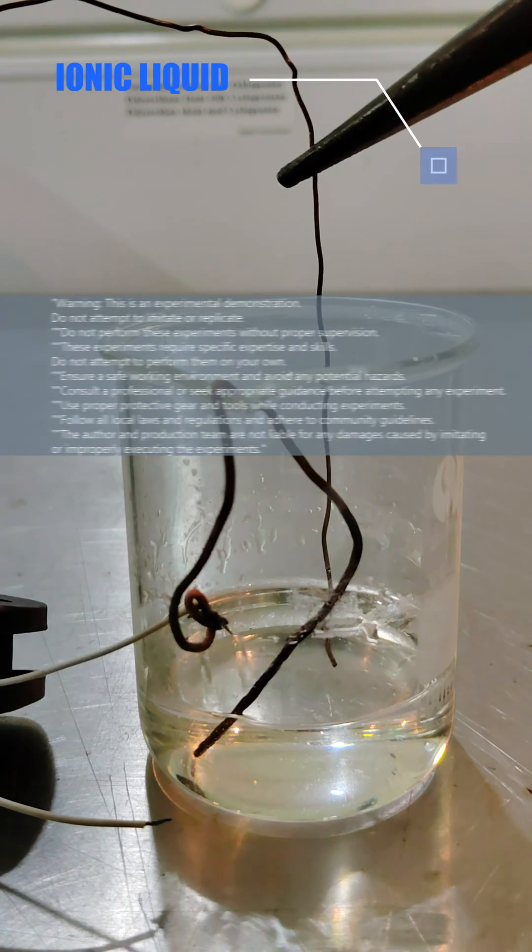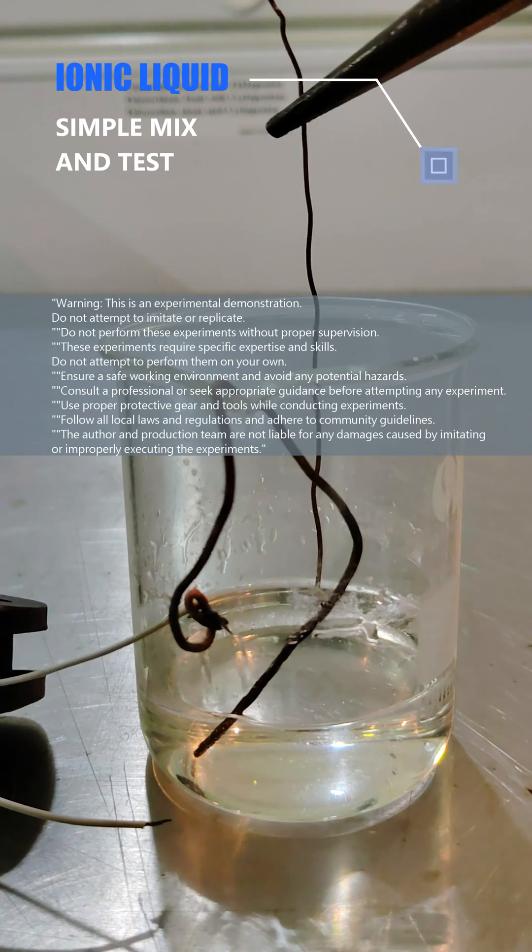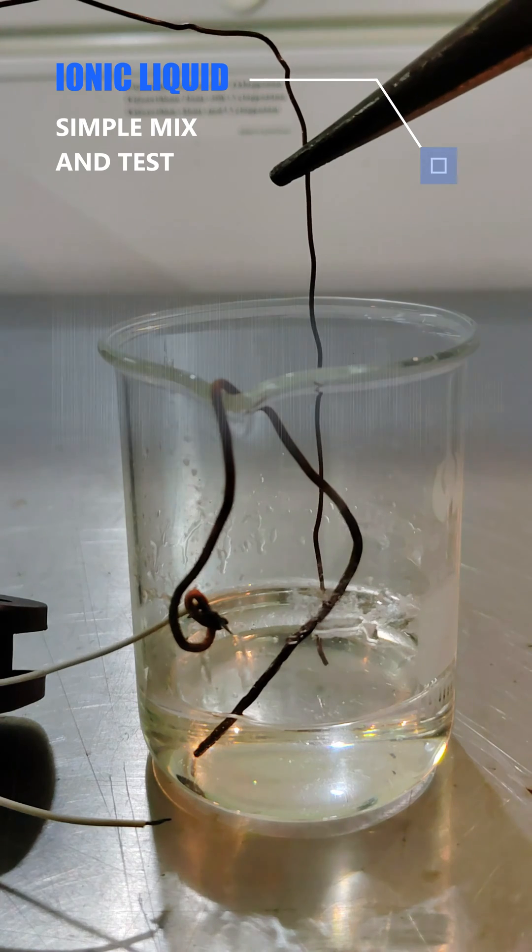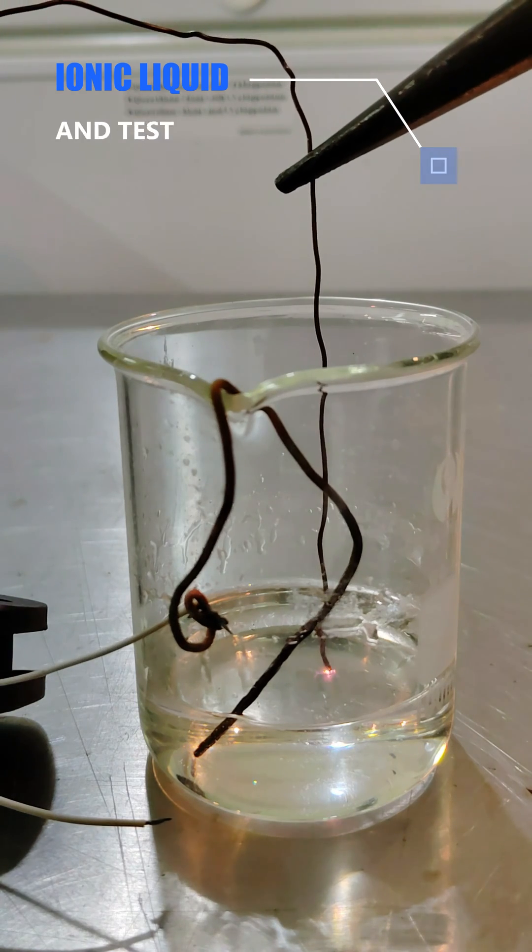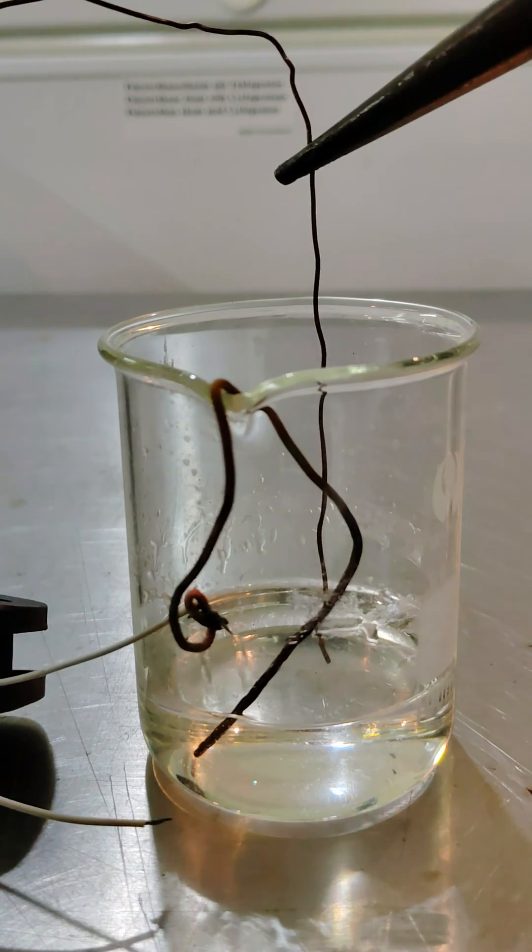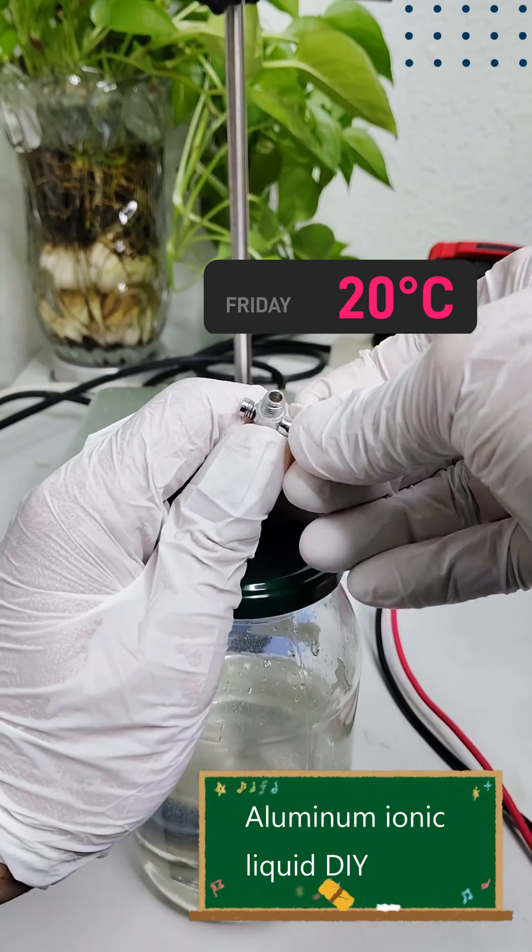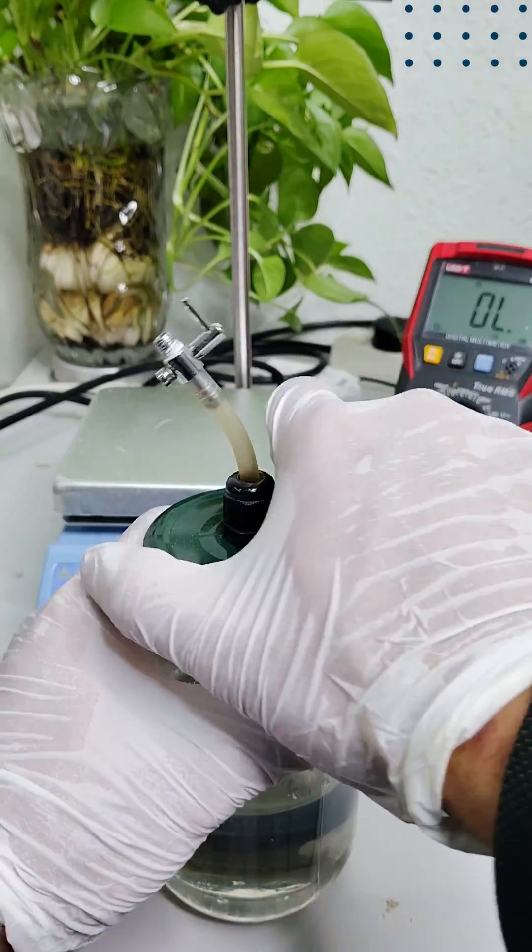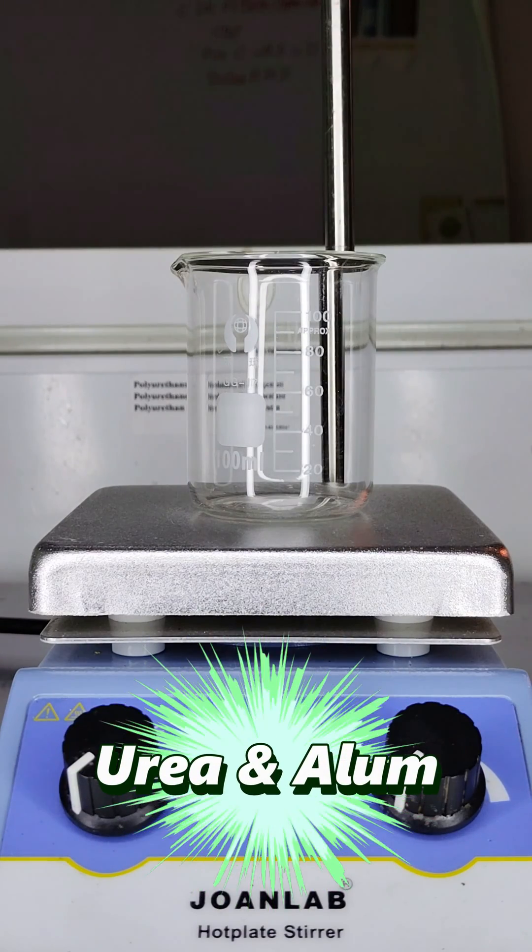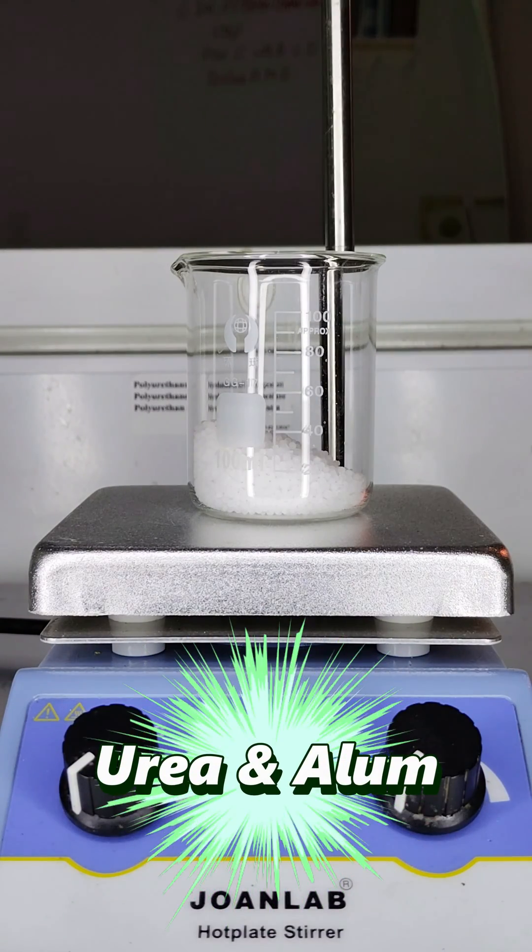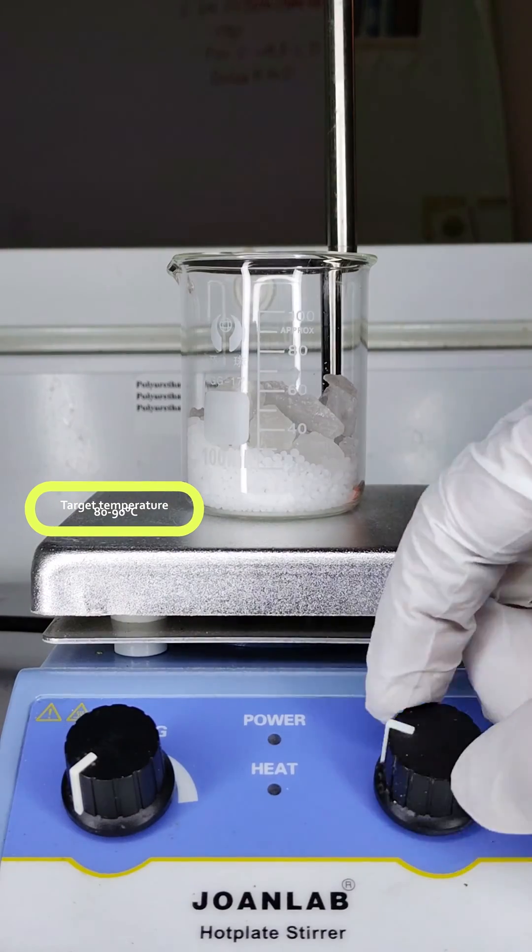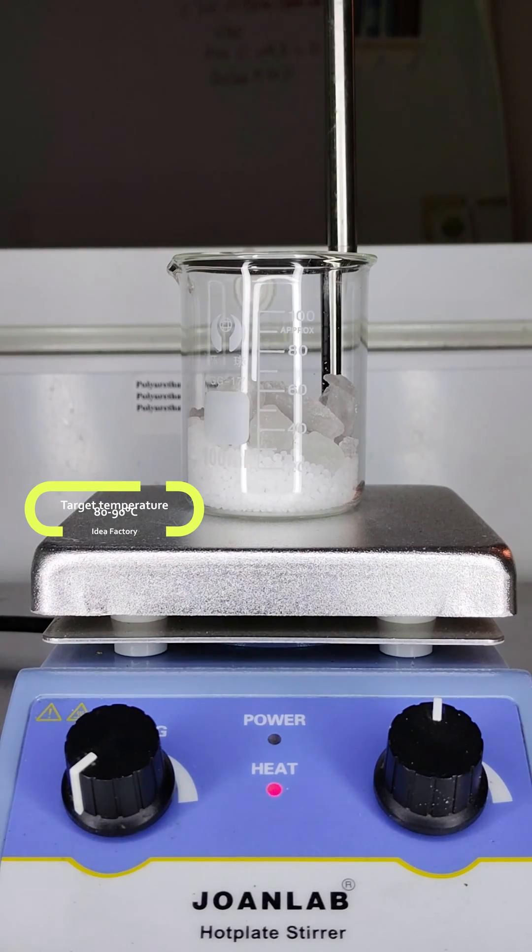Welcome to this comprehensive guide on creating and utilizing aluminum ionic liquid. In this video, I will walk you through the step-by-step process of making your own aluminum ionic liquid and provide insights into its diverse applications in fields like electrochemistry and materials science.